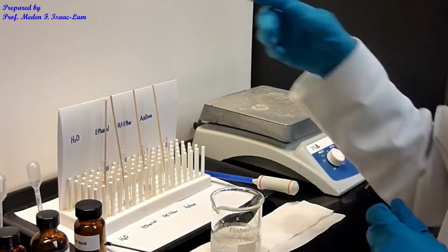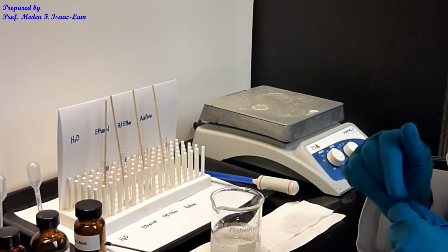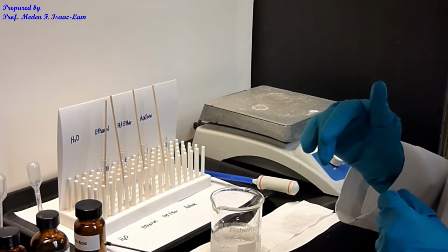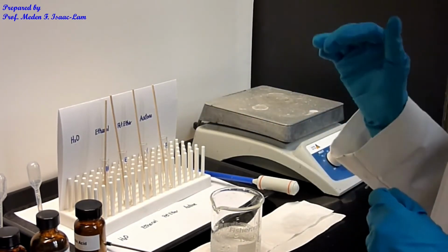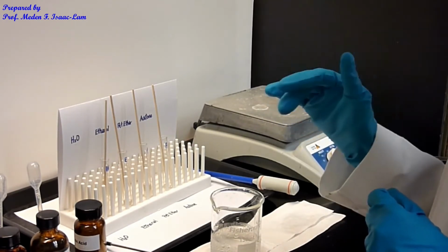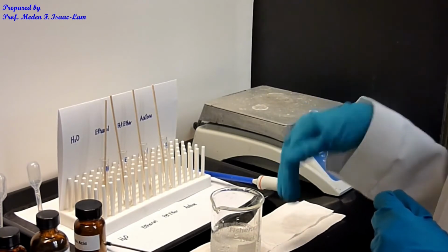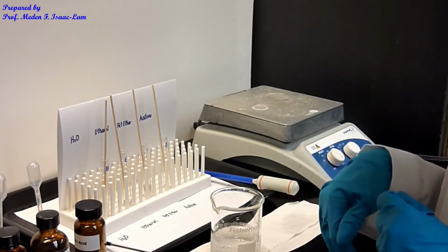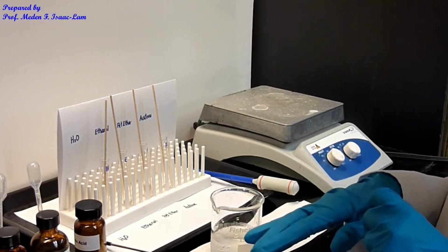of the solvent for the water and then petroleum ether, and then I heated it up, and then I got it to dissolve. The water took a little bit longer to dissolve, but the petroleum ether was faster in terms of dissolving in the solvent, and then when I chilled both in ice water, I got back the crystals. Basically, that's it for part A, and we're now going to do part B.